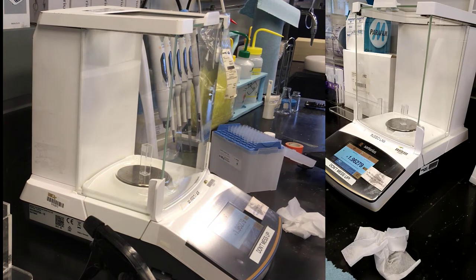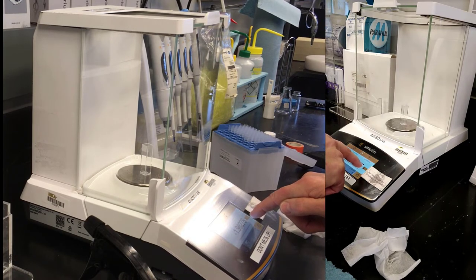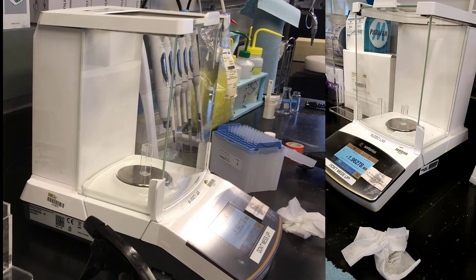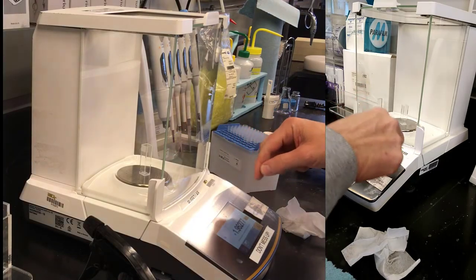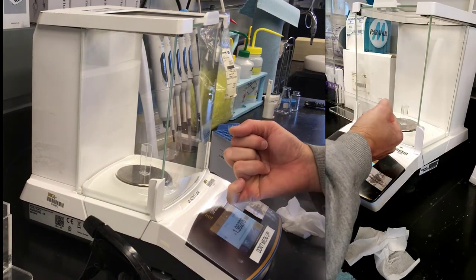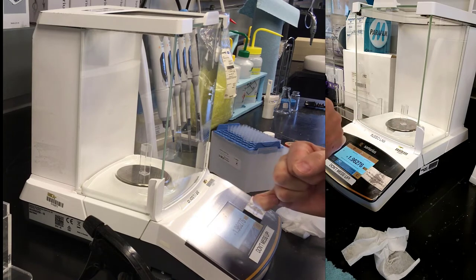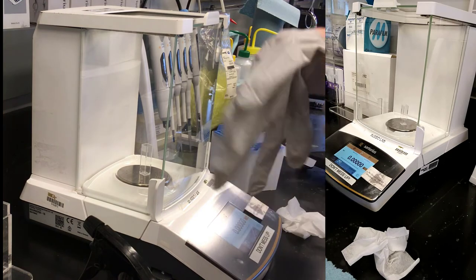Okay, so it is settled, and I know that because the little G light has come on. Otherwise it was kind of grayed out slightly. And I should write this number down, 1.96277. I would write that down in my lab book, and then I'll tare it. I'll do that with a knuckle. Knuckles are clean. And I'll put gloves back on.